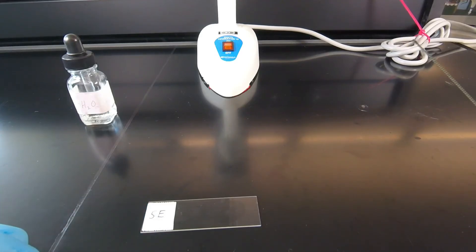So now we've spread the bacteria out on the slide and we're going to sterilize the loop again since there's a lot of bacteria on the loop from the spreading technique.